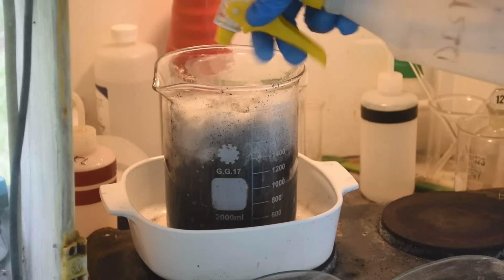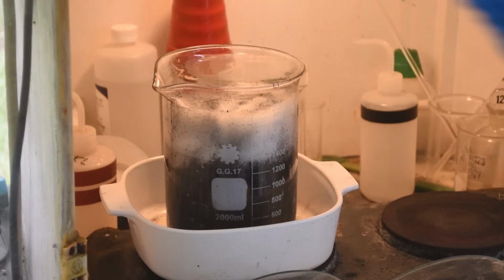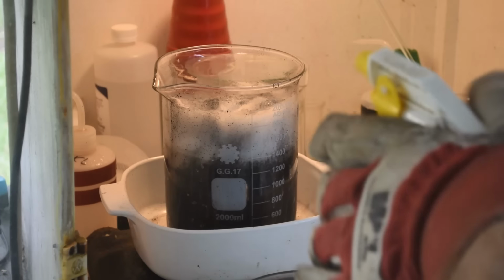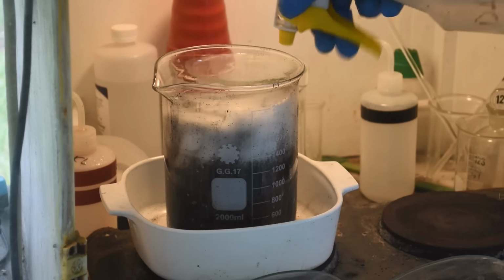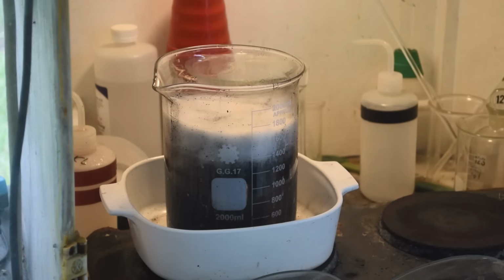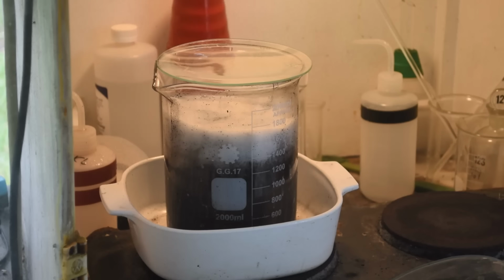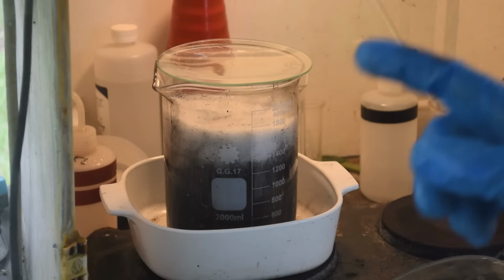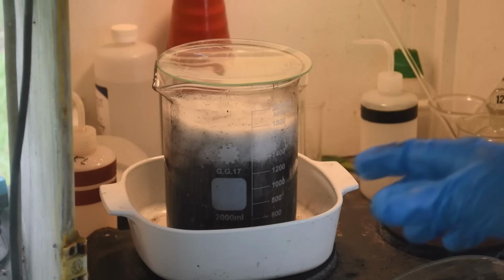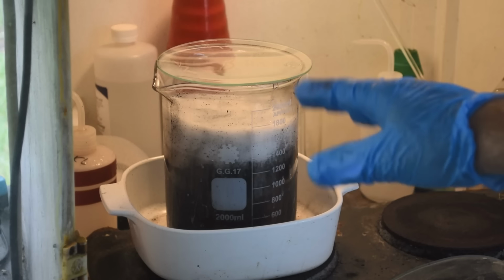Nice. I mean, not nice that it boiled over, but wow, that's some serious palladium there. Yeah, so we're going to have a little bit of losses with this. All right. Let it cool down, see what it looks like. I may try boiling it again if it doesn't look like all the palladium's come down, but watch it a lot more carefully.